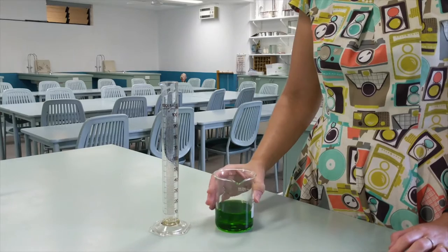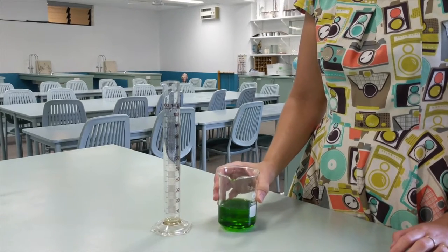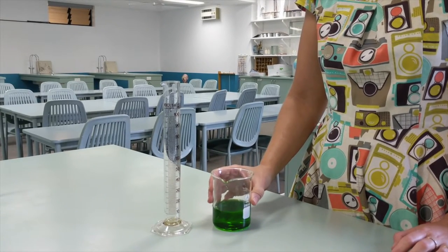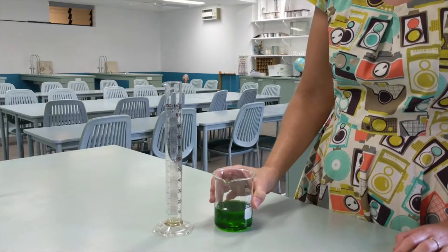First you'd collect your liquid, your chemical, from the teacher's bench in a beaker. Only take just about as much as you think you'll need.